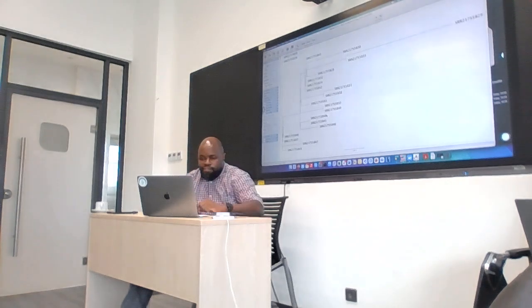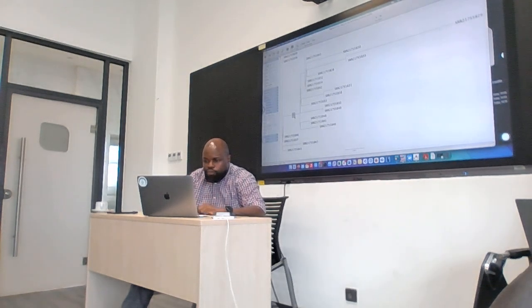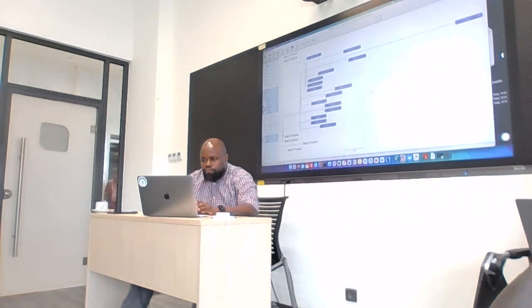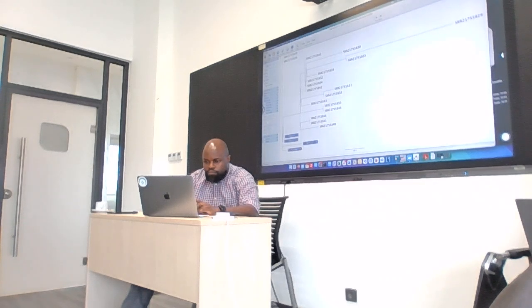Then, because I want to move fast, I'm going to select this node here. And for this taxa, I'm going to annotate. And I'll say country USA. Okay? And then I'll click this one, this one, this one. I'm going to annotate. Let's say country. Who wants me to use their country? Burundi. And then I'll select these two here. And I'll annotate them. DRC.